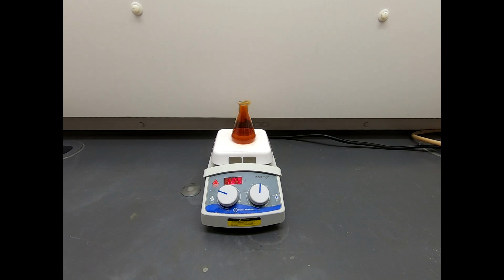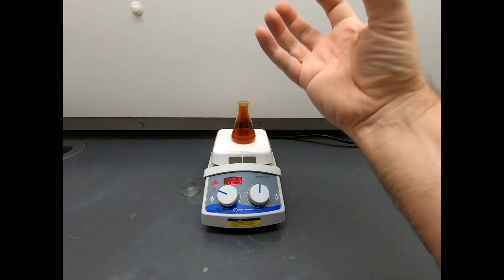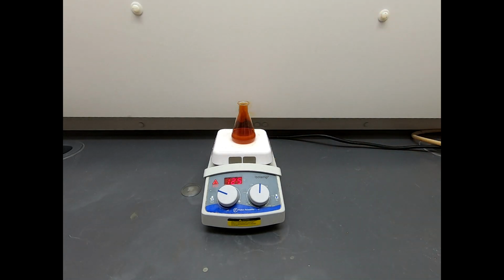And so what I'm going to do is sample this reaction. I'm going to take it off the hot plate and let it settle so that the oily layer comes to the top. And I'm going to sample that oily layer and look at that by TLC, and we'll be able to monitor and see if we still have starting material or not in this reaction using a 3-lane TLC plate. So that is the plan.